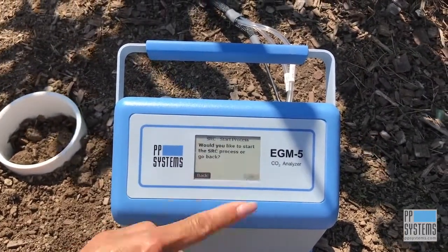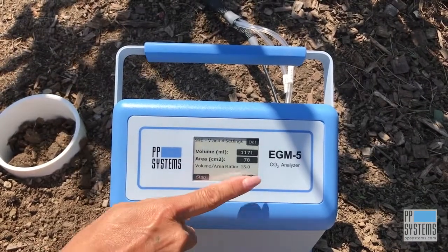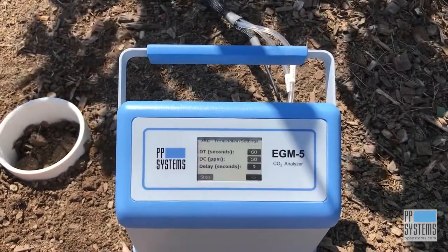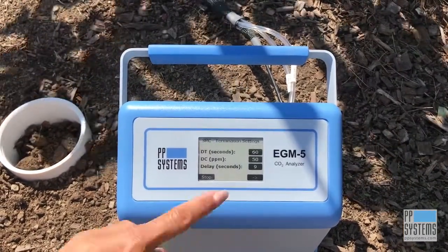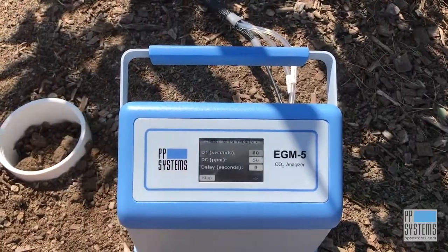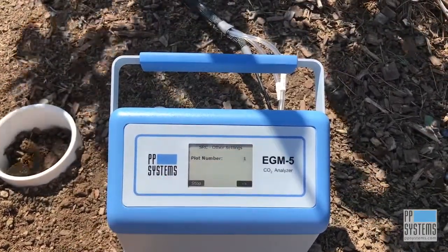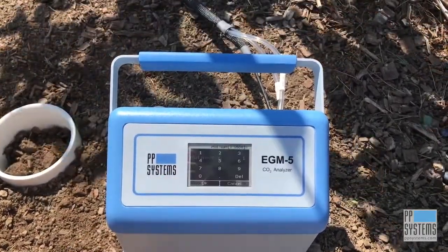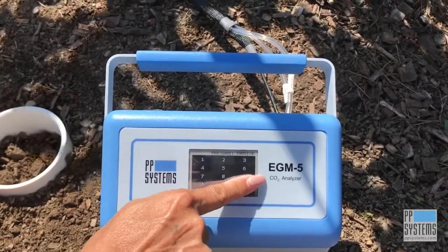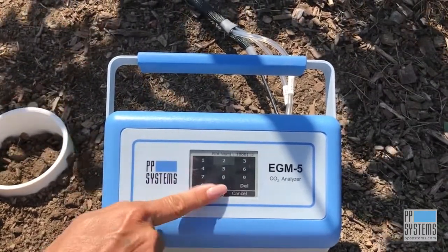Next, press the right arrow to begin the measurement process. The next display shows the default settings associated with the SRC-2 respiration chamber. Enter your plot number to identify your measurement location, and after that, simply follow the instructions on the display.